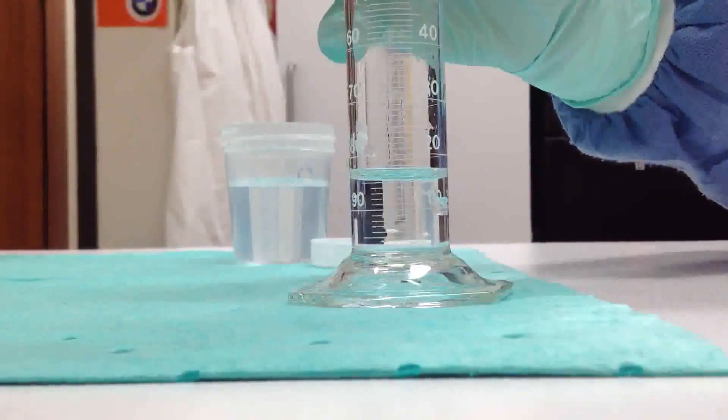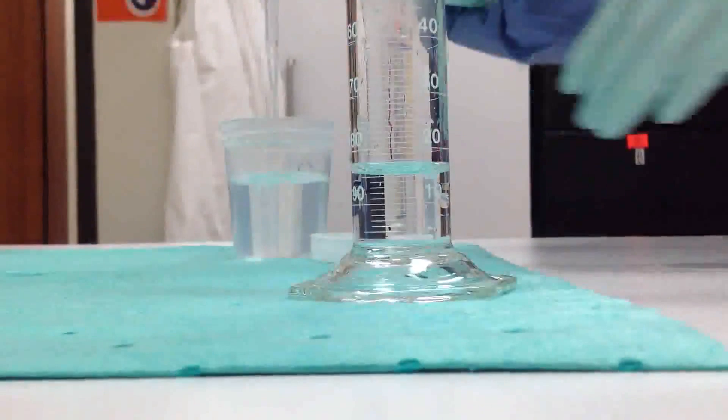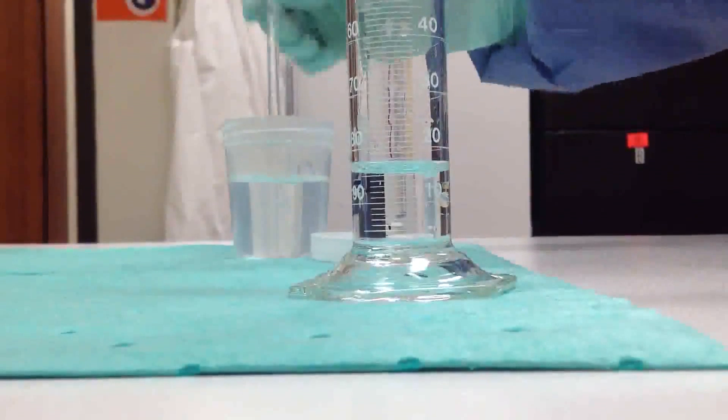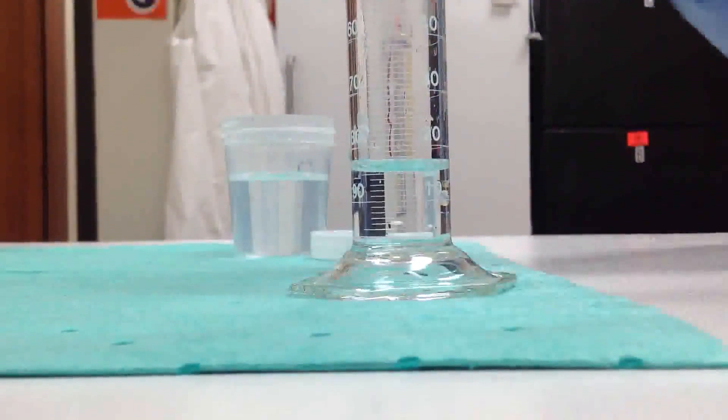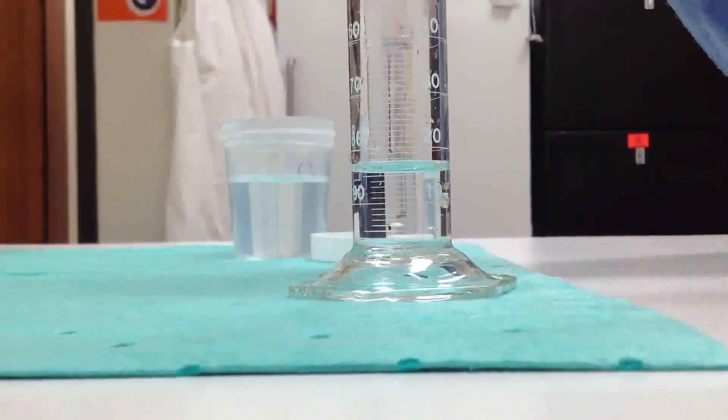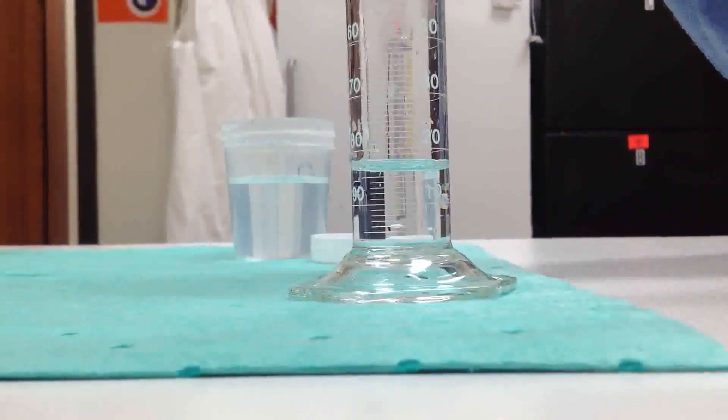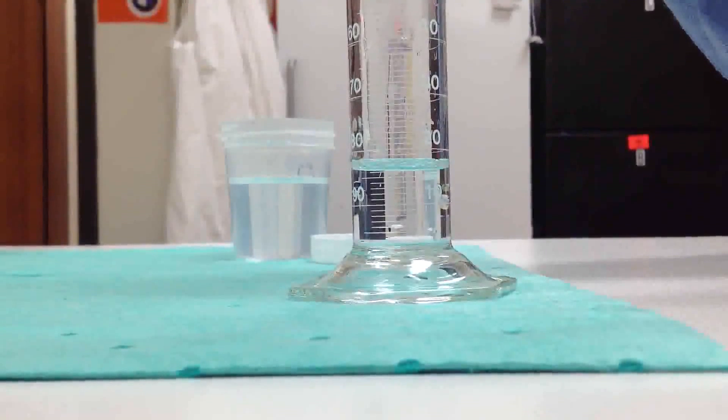Okay, what do you think? Just a little bit, right. Looks like we're about at 15 ml. So she needs to add a little bit slowly down the side so it doesn't splash and make bubbles. Moving it up one more line to the 16.